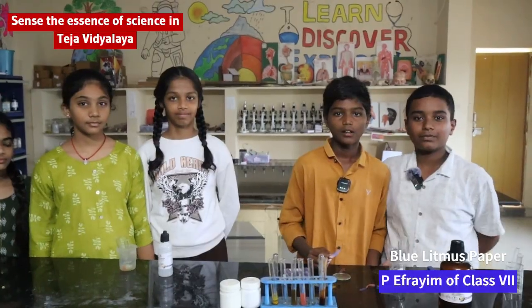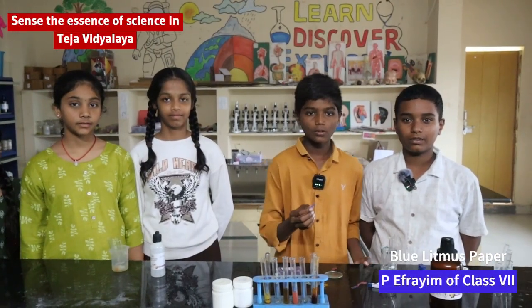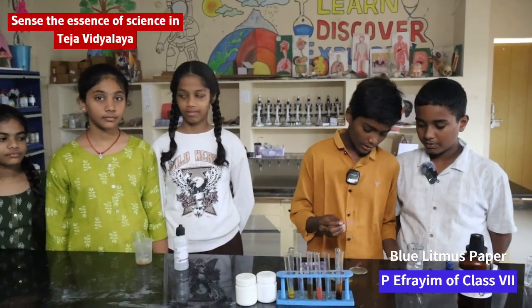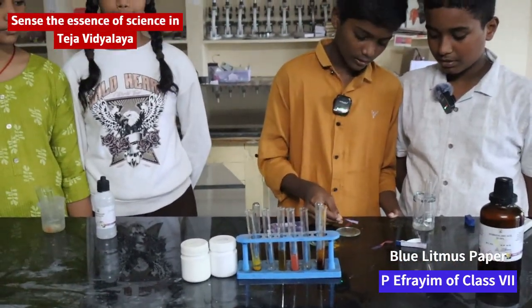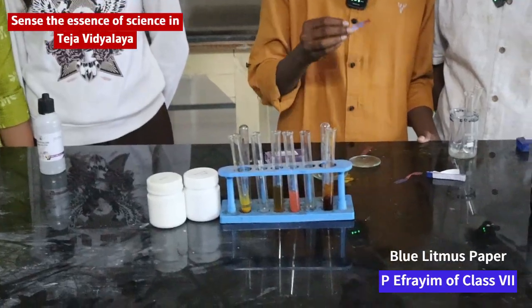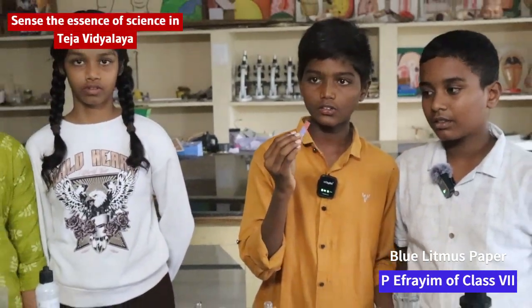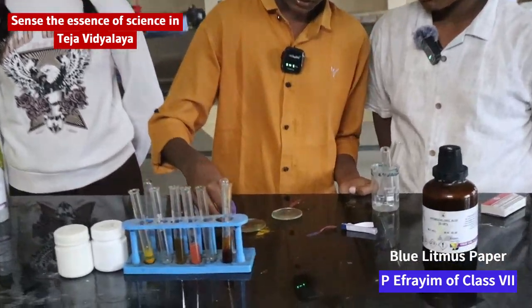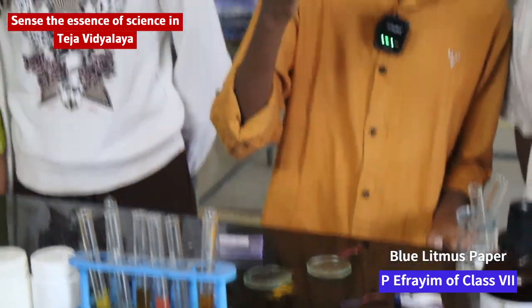My name is Ephraim. Now I am telling about how blue litmus paper changes its color with acid and base. When blue litmus paper is dipped in acid, it changes its color into red. When we dip it in base, it changes its color into blue.